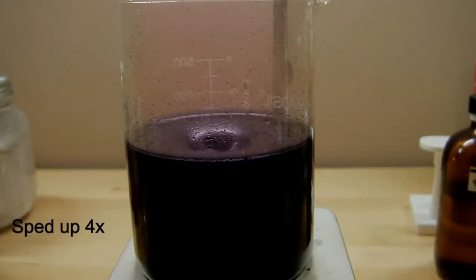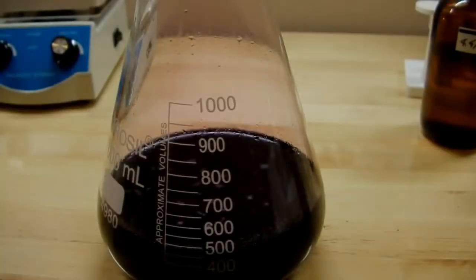And the iodine vapor can collect over it because I've put a petri dish on top of it to sort of contain that, as well as the splashing that's caused by the magnetic stirring. So now all we've got to do is try to get rid of this. So let's try to neutralize it.